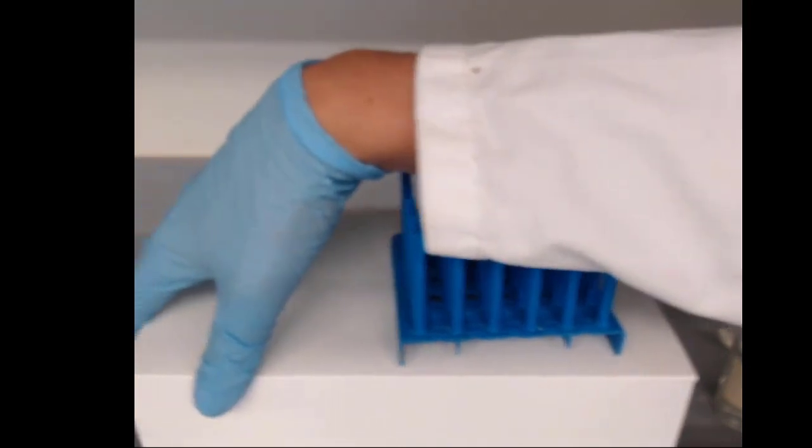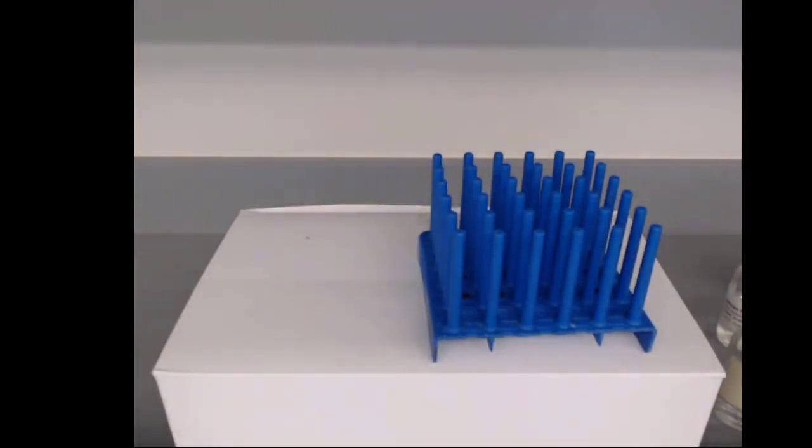Now, for our next one, I want to set it up. It's visually very interesting but slow. So we'll be doing a time lapse for this one.